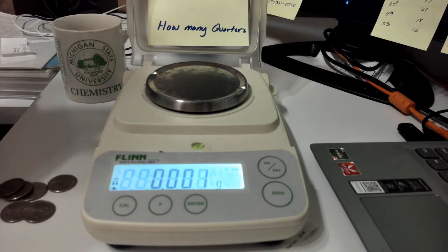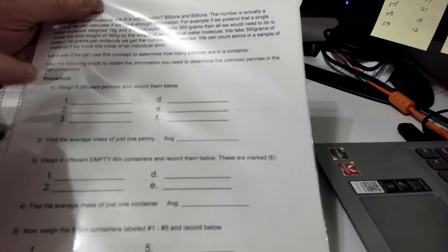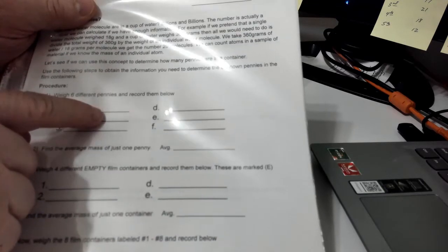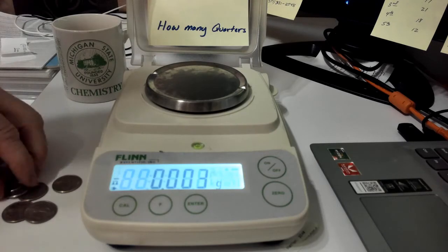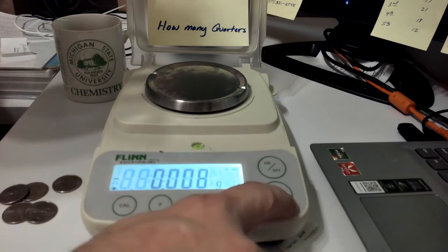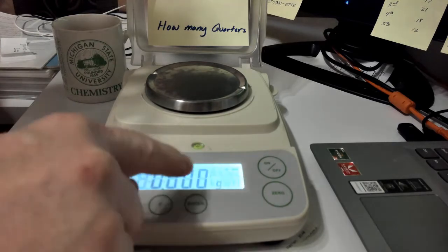The first thing we need to do, after you read down through the lab posted on today's date, is weigh 6 quarters so we can find their average. So let's start here with weighing 6 quarters. I will help you with them. Here we go, our first quarter. Let me make sure I got it on 0. It looks like it's a little high, so let me push the 0 and re-zero it. There we go.